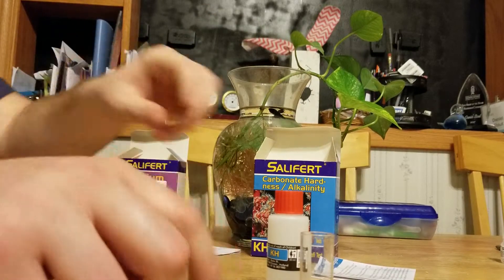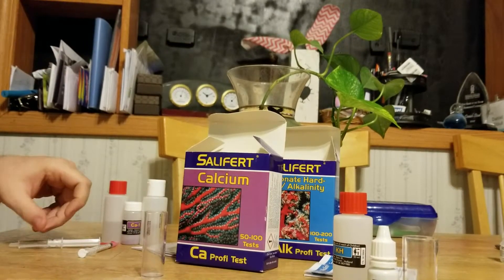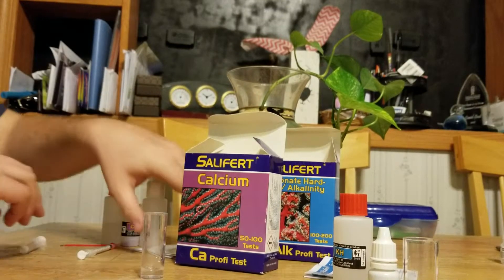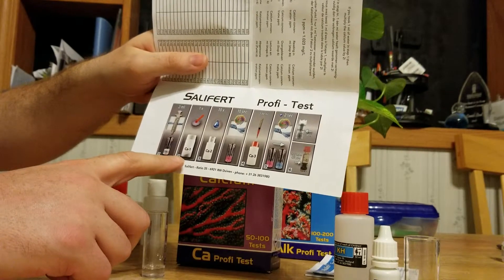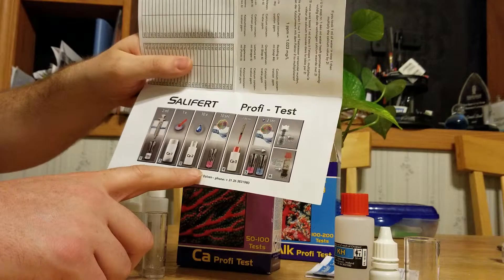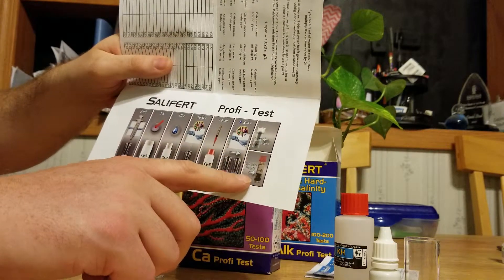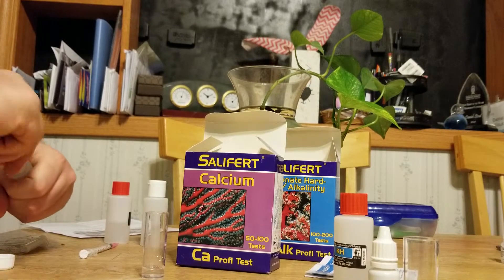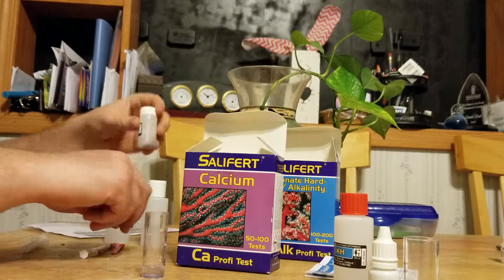Let's move on to the calcium kit. This one has a couple more steps — it's got three solutions. First, start out with two milliliters of water. It has nice instructions with pictures: two milliliters of water, one scoop of solution A, ten drops of solution B, shake for ten seconds, then one milliliter of solution C. It's gonna go from pink to blue, and whatever is left is your reading. It gives you a chart.